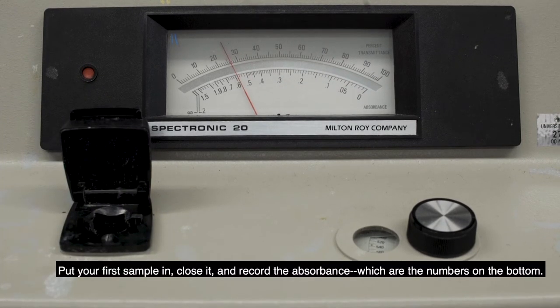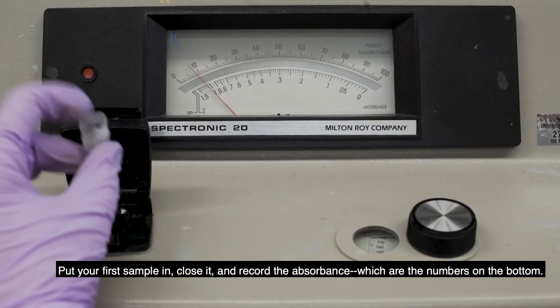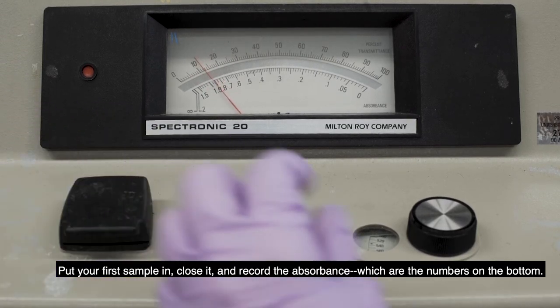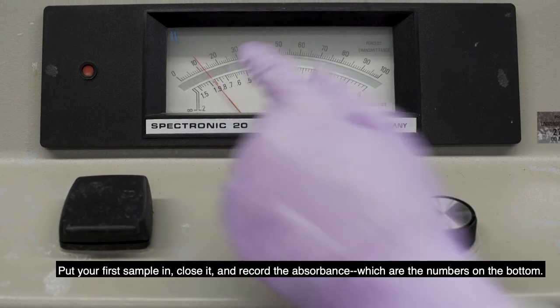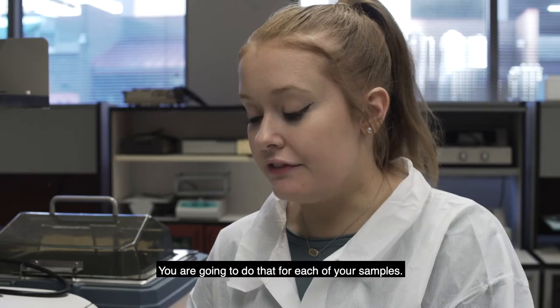So you're going to put your first sample in and then close it and then you're going to record the absorbance, which is the numbers in the bottom. You're going to do that for each of your samples.